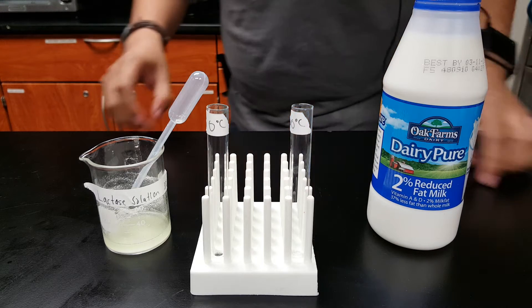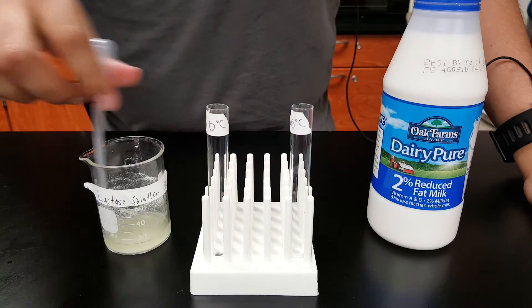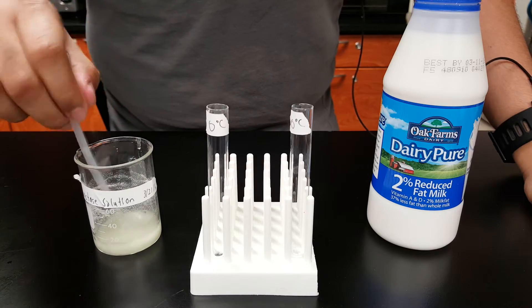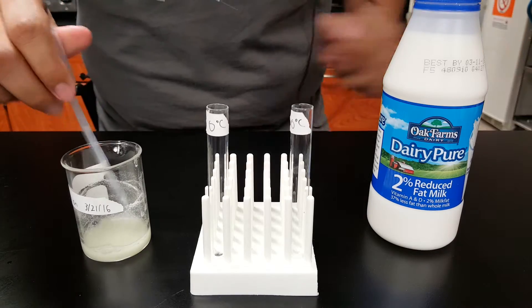All right, for your experiment today, I'm going to demonstrate how you do the experiment for zero degrees Celsius.